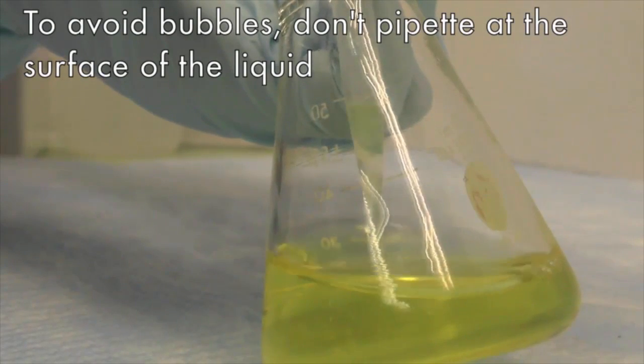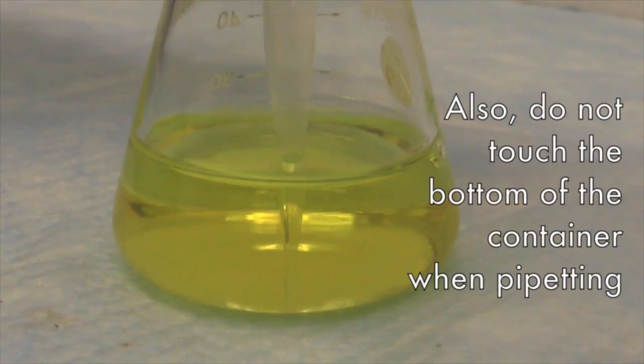To avoid error of pipetting, never draw at the surface of the liquid nor at the very bottom.